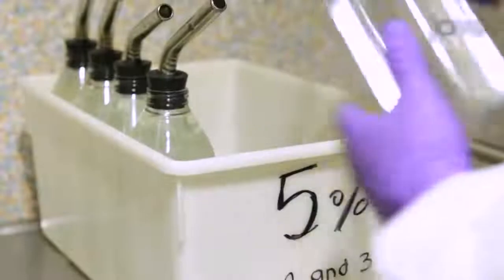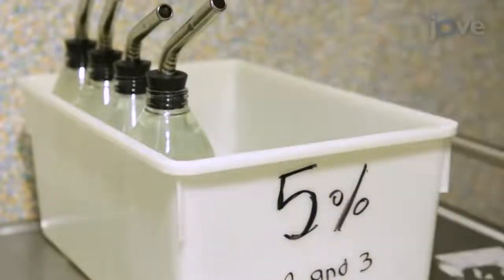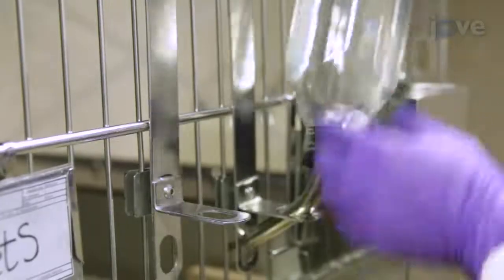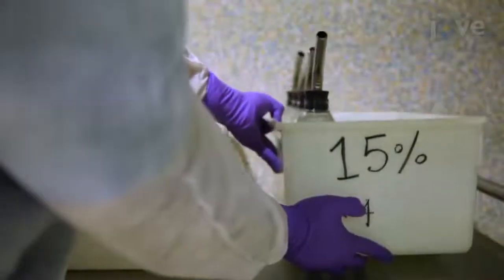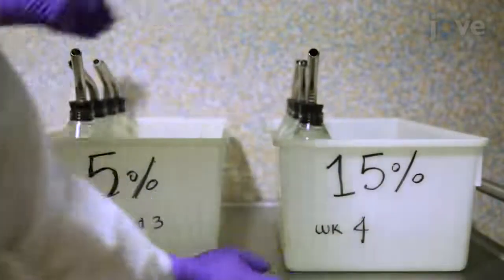In addition, give the animals in the Met S group water with 5% sucrose at the start, and increase the sucrose concentration to 15% by the end of the fourth week.